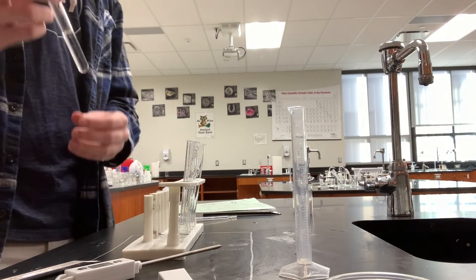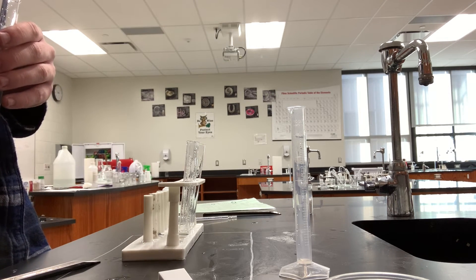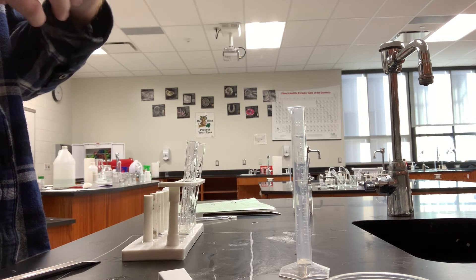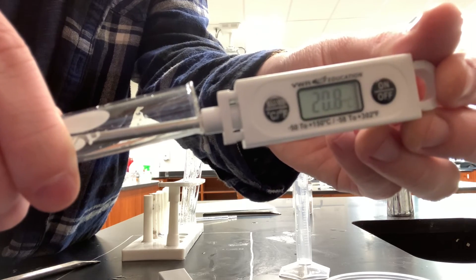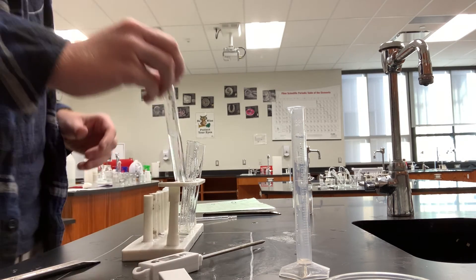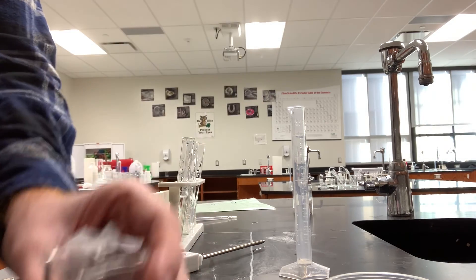This is part four of the lab and I've got 10 milliliters of water again in this test tube. We're just going to check the temperature of that again. It's about room temperature. Now we're going to add a little bit of this calcium chloride right here into the water.